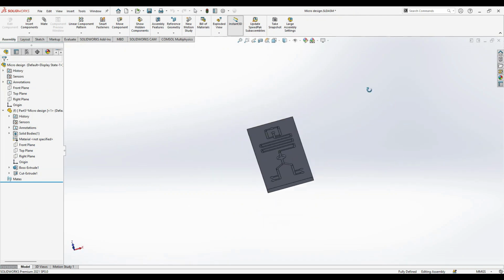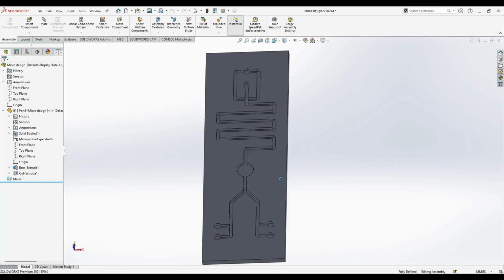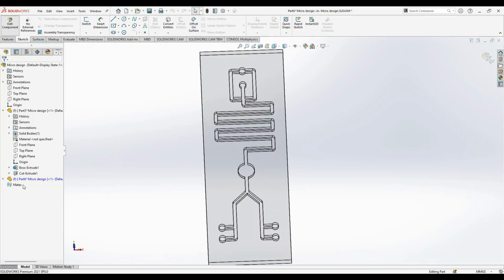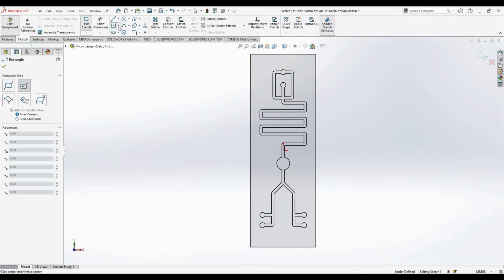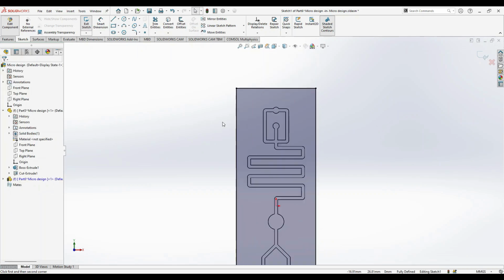And now the first part is done. So we have a channel which is engraved into the substrate. Now we have to create the inlets to this, so go to insert, create a new part, and edit this part. We want to sketch on this, a similar, same rectangle first of all, and then we add inlets to this.